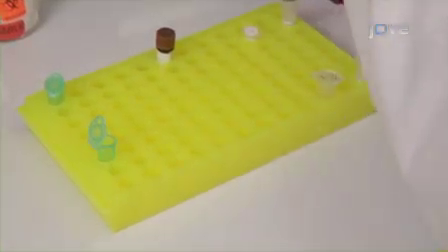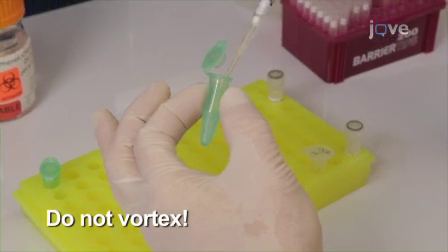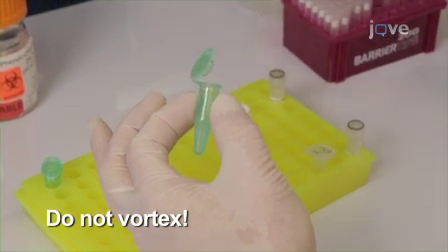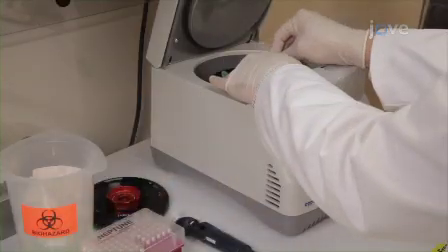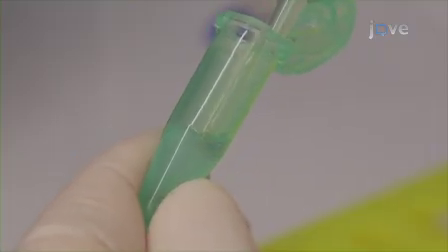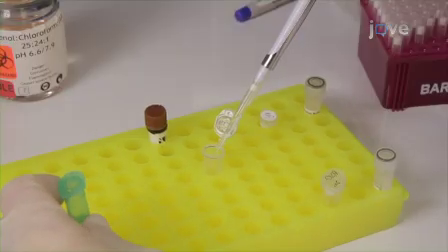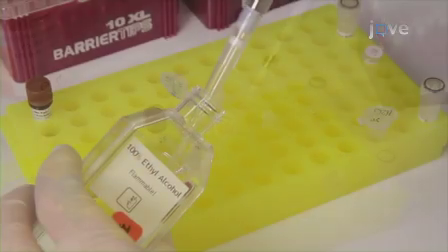Next, use a micropipette to transfer all of the cDNA PCI mixture to the phase-lock gel tube. Do not vortex the phase-lock gel tube. Centrifuge at full speed for 2 minutes. Then use a micropipette to transfer the top layer from the phase-lock gel tube to a newly labeled 1.7 milliliter tube. Try to collect as much of the layer as possible.